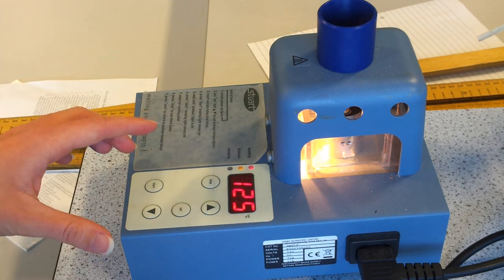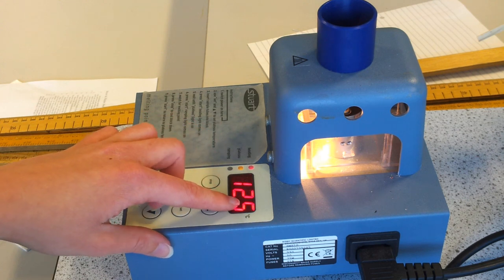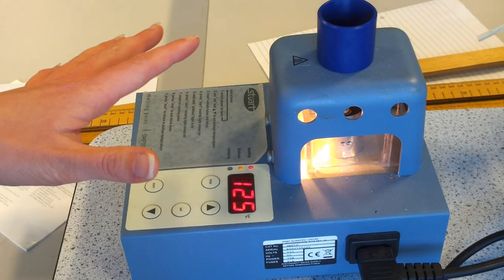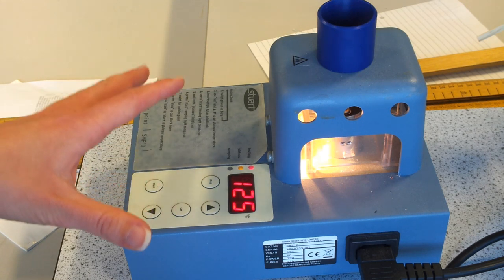We have set this up so it's reached 125 degrees, that's 10 degrees below the melting point that we're after, so we don't have to wait too long.